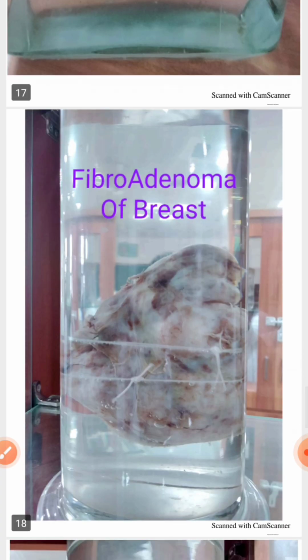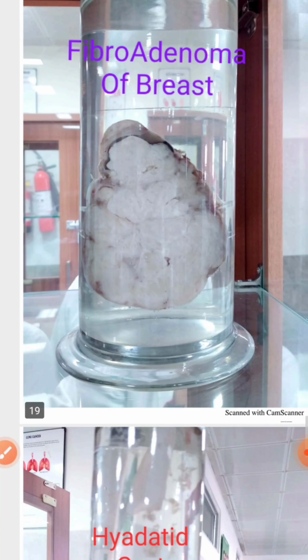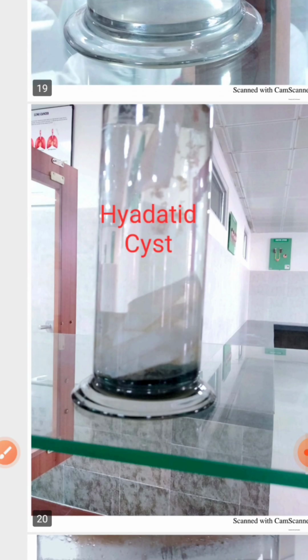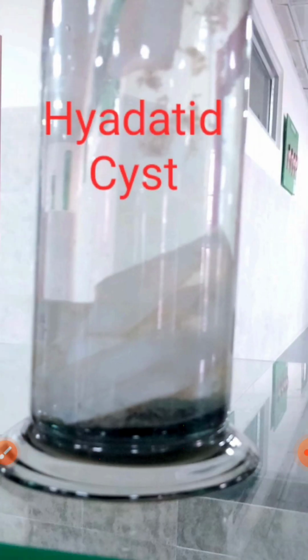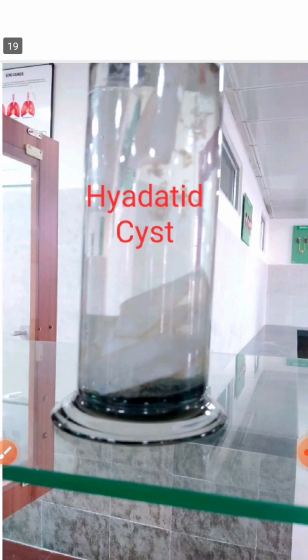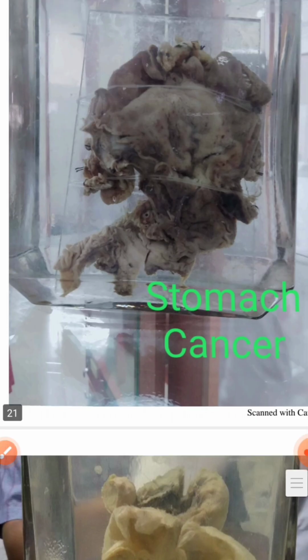Okay, fibroadenoma breast, this is a benign condition. You can see this is a fibroadenoma. Another one is hydatid cyst. If your college has a hydatid cyst, it may be white hollow balls filled with fluid. So hydatid cyst may be present.